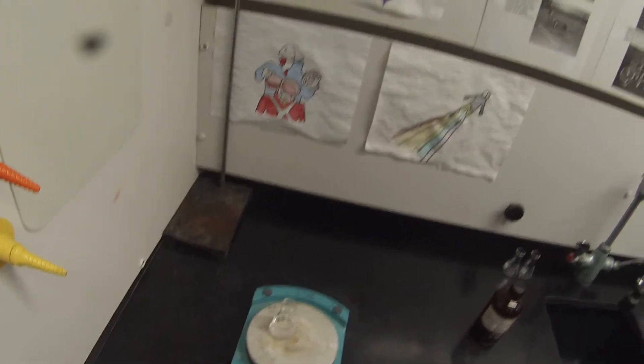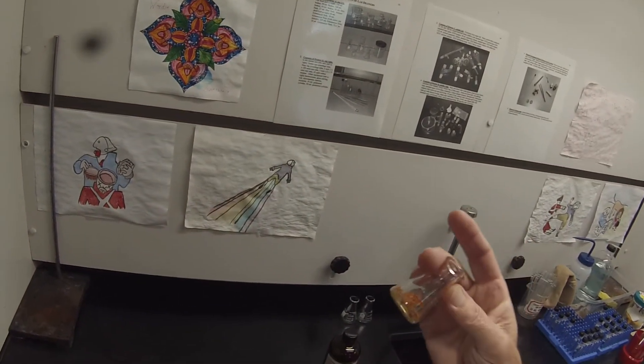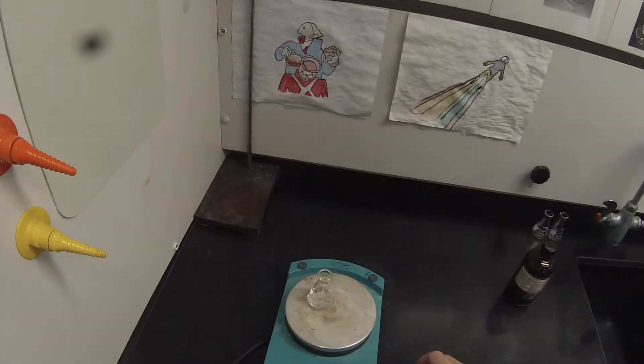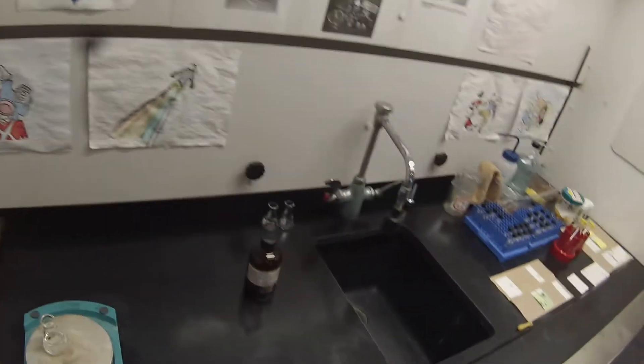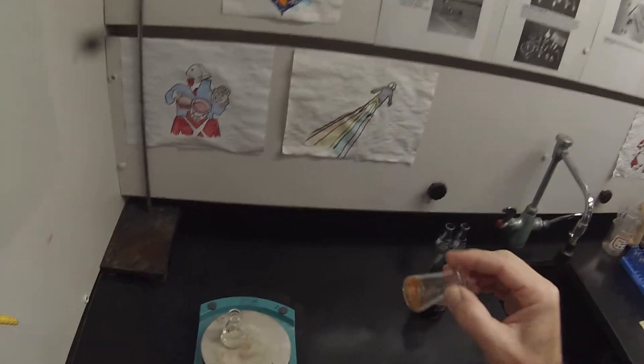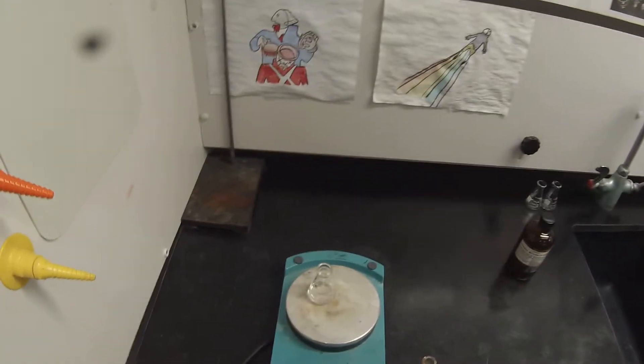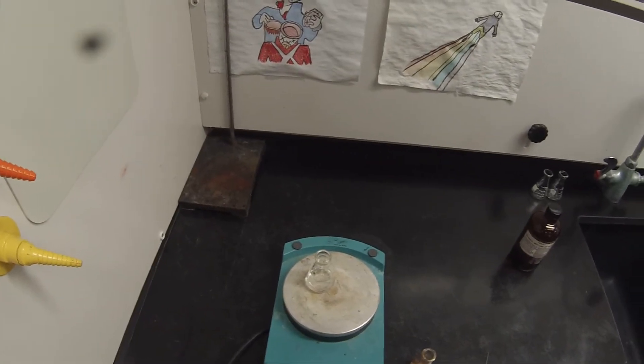As we've discovered, if they don't tell you what the ratio is for a mixed solvent system, it's sometimes hard to come up with a good system. If we can get white crystals out of this kind of orangey powder, that would be an achievement. The tryptamine has been gradually decomposing — probably oxidizing in the air over the last week or so.